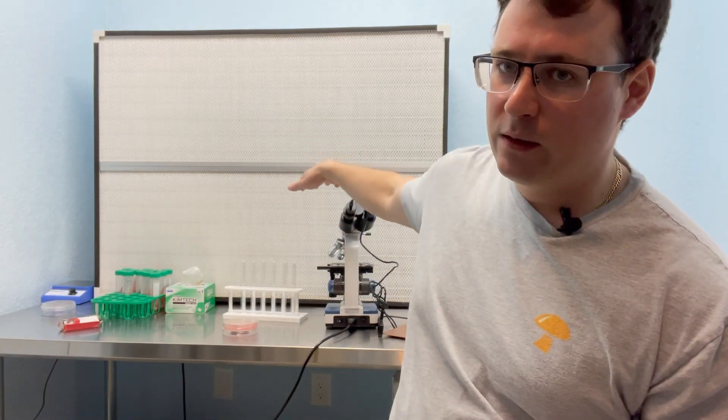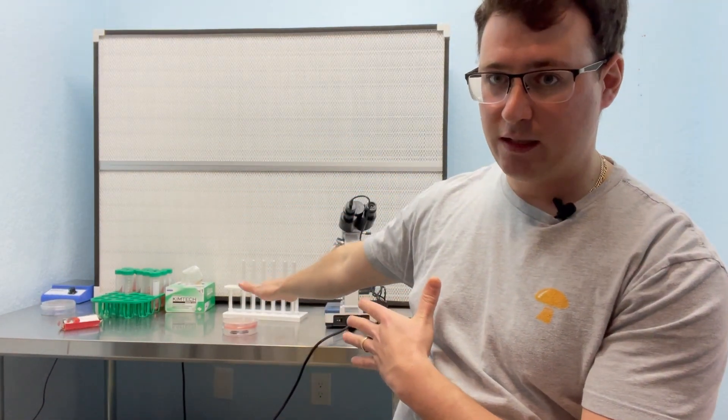That is going to require the use of a microscope. I'm still going to do my serial dilutions to get down to a single spore.